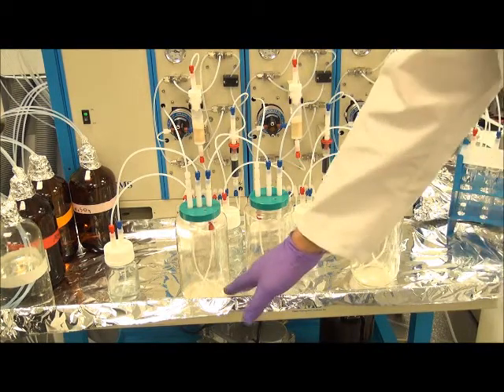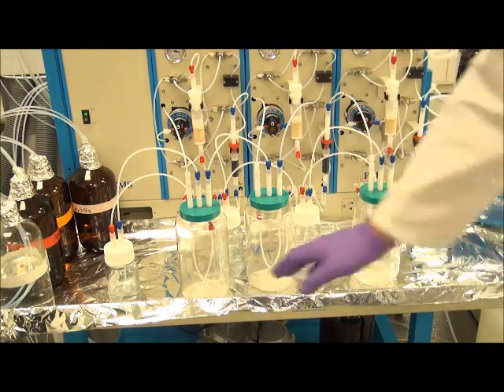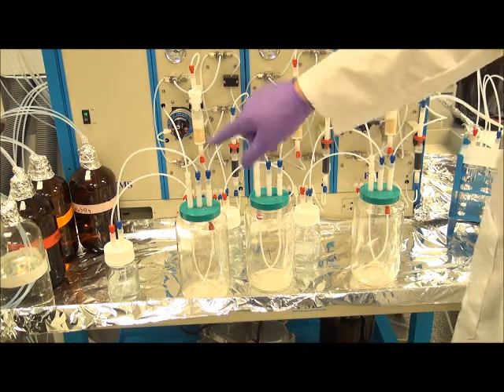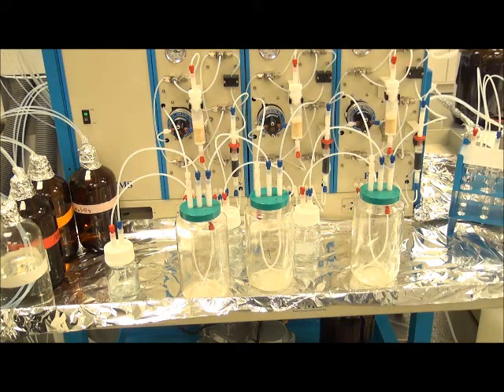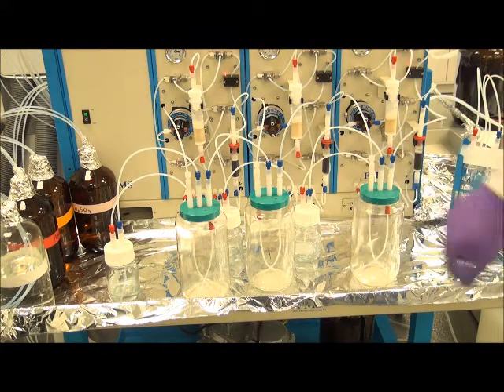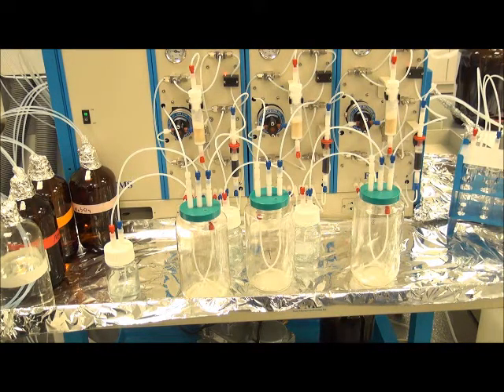Now we're finishing up the sample loading. You can see all the sample bottles reaching their end line, and then momentarily the valves will begin to turn off as bubbles from air pass across the sensors. We need to draw the air as the sample is finishing. Sample 1 is closed. Once the last sample finishes the remaining volume, the program will proceed to the next step.